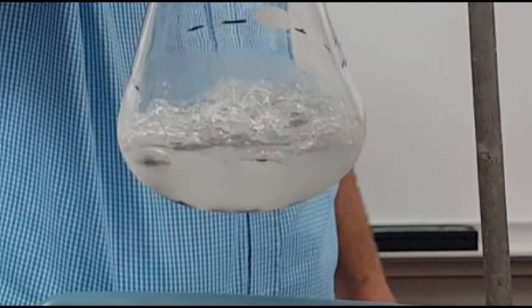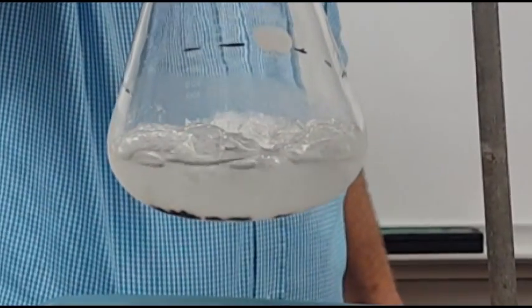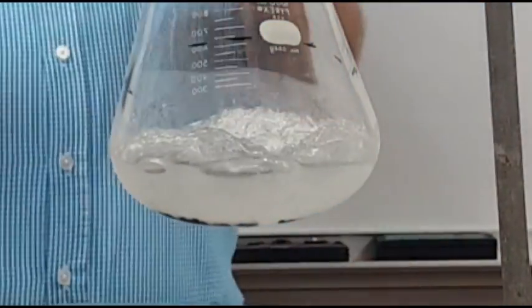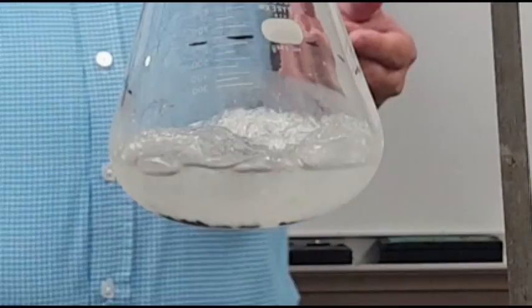If I turn this to the camera a little bit, you might be able to see the liquid or the solid and liquid together a little better. So that's the triple point of cyclohexane.